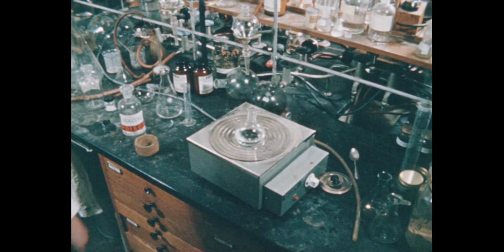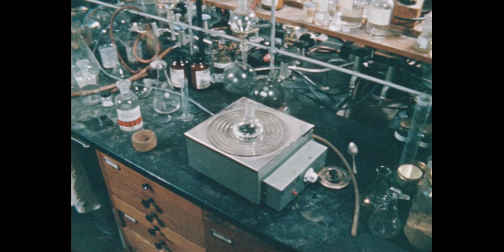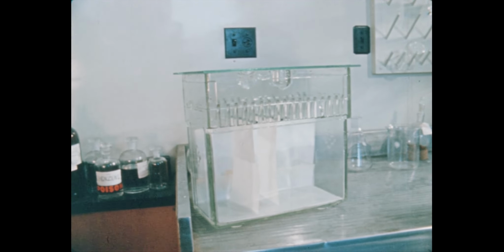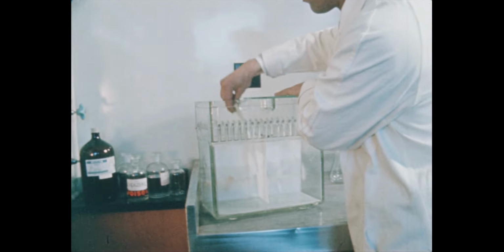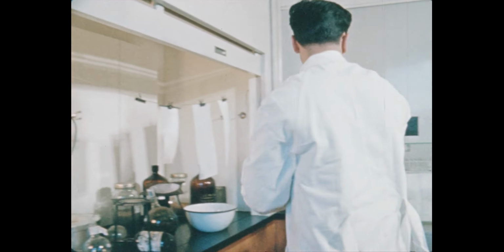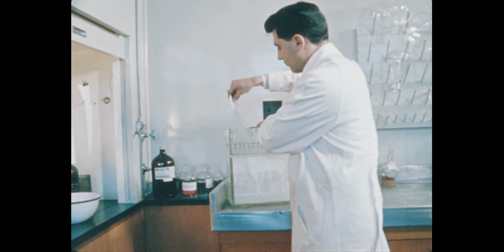And now he's greatly increasing the danger by boiling off the solvent. Only the fume cupboard can provide a safe place for this work. Again, out come the vapors, building up the danger level. In paper chromatography work, benzene must be handled where it can do no harm, entirely in the fume cupboard.